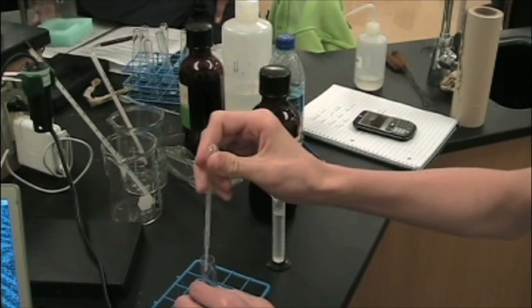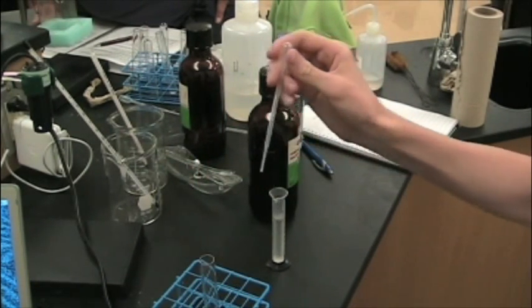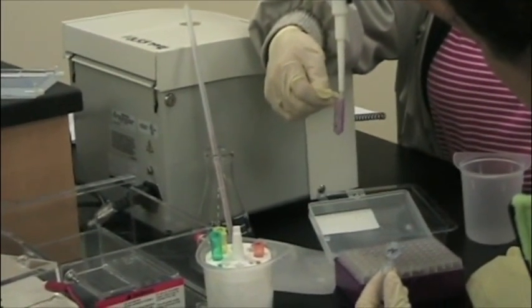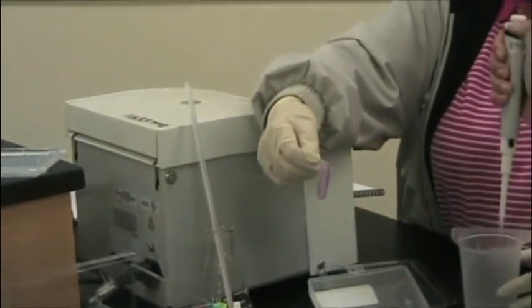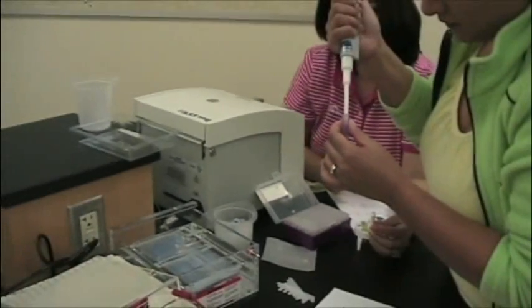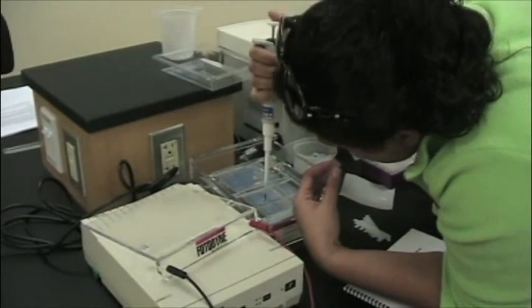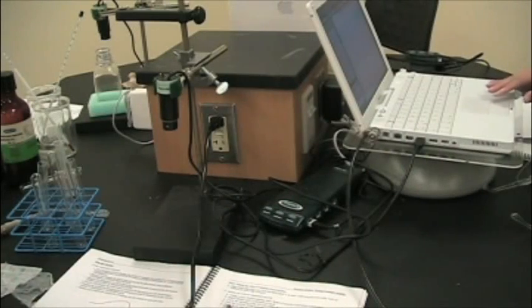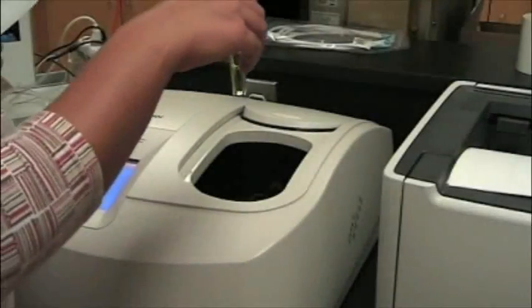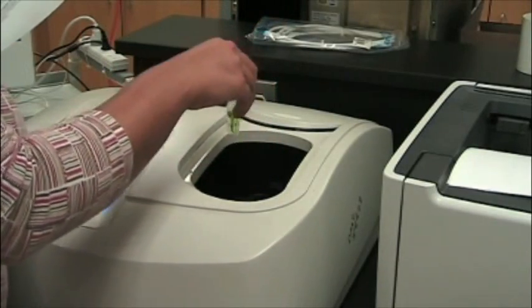Pipetting is one of the most fundamental procedures used in biology, microbiology, chemistry, as well as any other science where accurate measures of volumes need to be used in experimental procedures. In the world of biology, scientists use pipettes on a daily basis. Similarly, in the different experiments that we performed, pipetting was the most frequently used technique, and we have come to believe that mastering this technique is important for a science student. This is why we have devoted this video to pipetting.